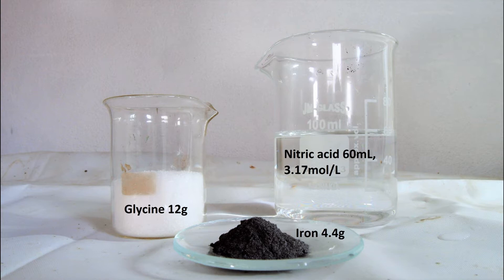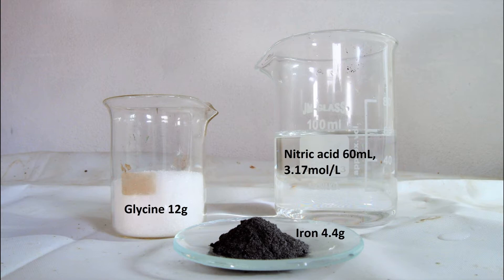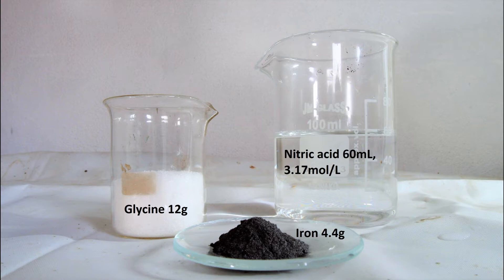It is called Solution Combustion Synthesis or SCS. In short, it consists of a reaction between a metal nitrate and a fuel, for which glycine or urea is most commonly used. Our starting materials are nitric acid, glycine, and iron powder.